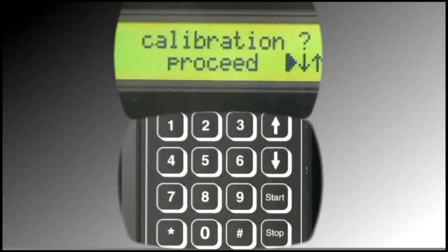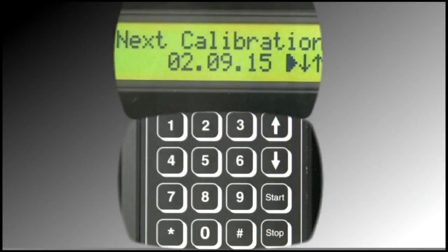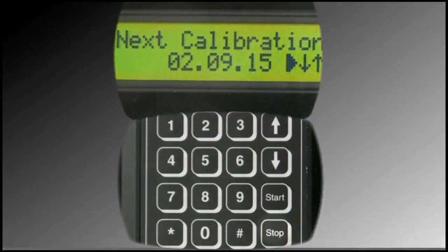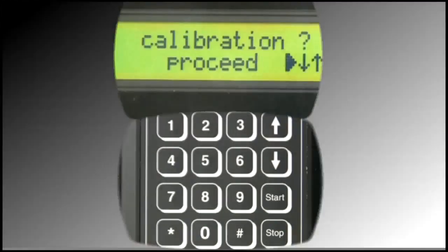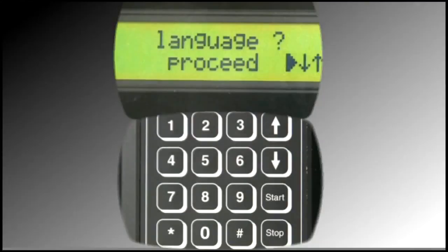This is the calibration menu. Press the Start button to view the next calibration date. Press the Stop button to return to the prior menu. Press the up arrow 4 times.